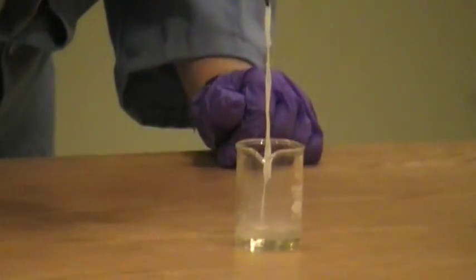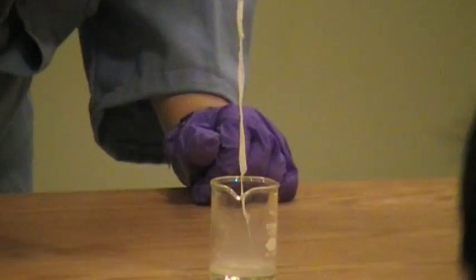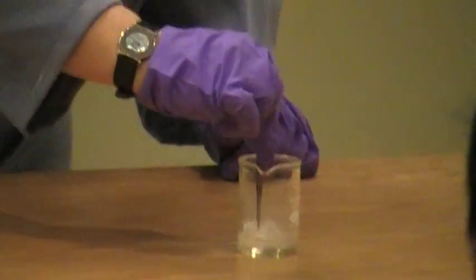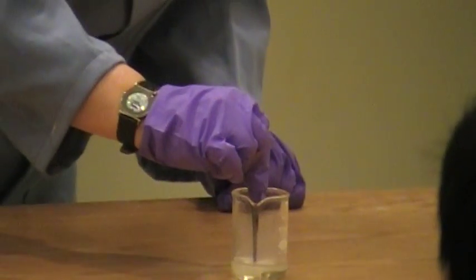But what's amazing is that, you know, little tiny molecules, which you can't, whoops, I dropped it. You can't see.